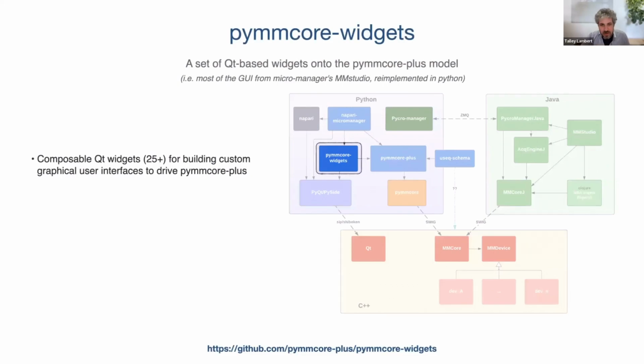So on top of that, there is PyMM Core Widgets. This is a library with a set of Qt-based widgets that are basically a view onto the PyMM Core Plus model. So you can think of these as widgets that will either just tell you the state of your microscope or control your microscope in a composable way. The goal here isn't quite to fully reconstruct an application. It's to give you a set of components that you could use to build your own customizable user interface.